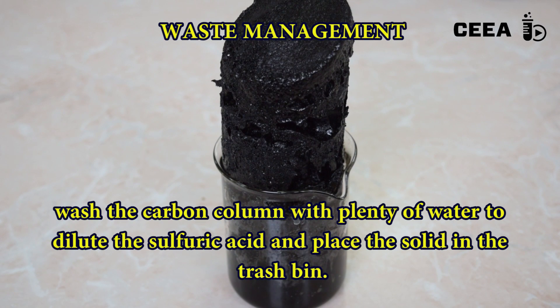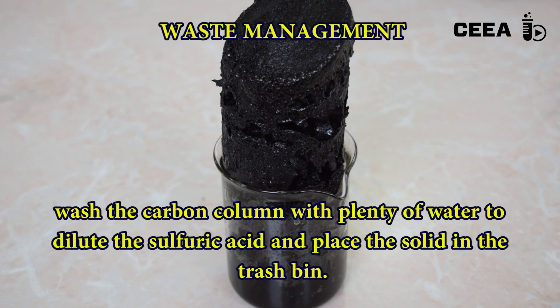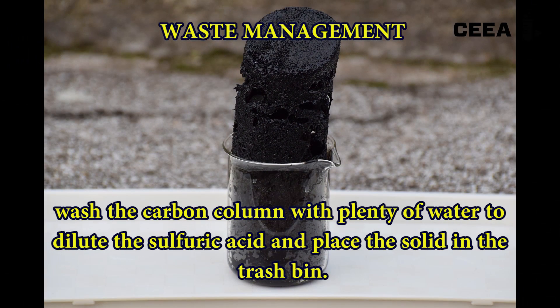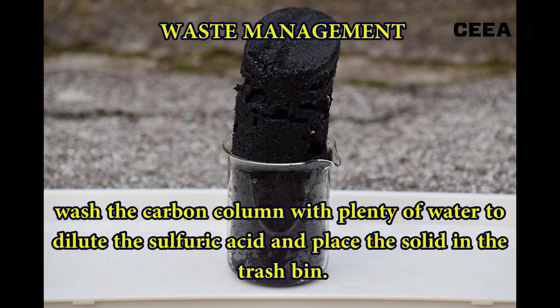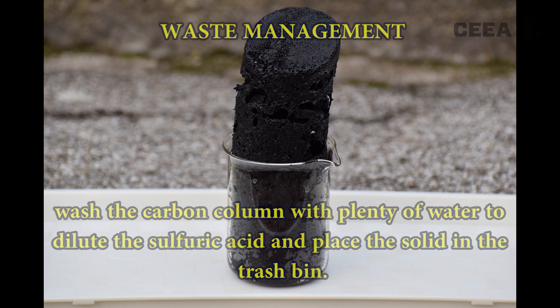The residues have to be diluted with water to wash out the sulfuric acid, and the solid can be discarded in the bin.